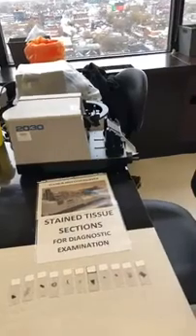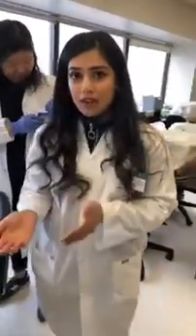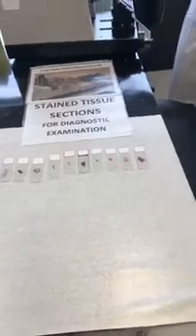After we put them in the wax block, we cut them down with machines called microtomes, cutting them into very thin slices of tissue. After cutting, we take them to the staining part of our lab. We have some pre-stained slides here and you can actually see some of the tissue details macroscopically. These tissues are examined by members of the hospital to diagnose the patient with what might be abnormal cells or possible pathologies.